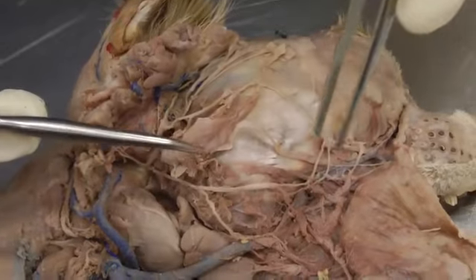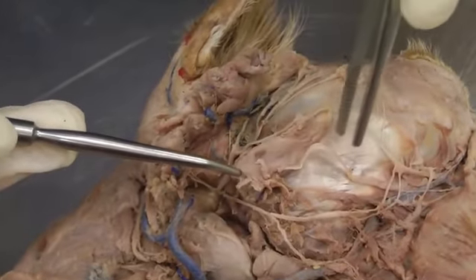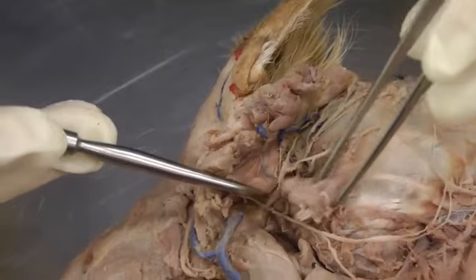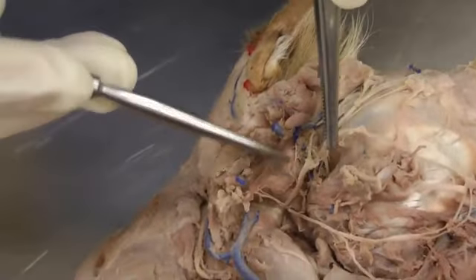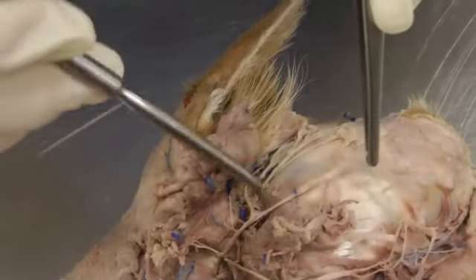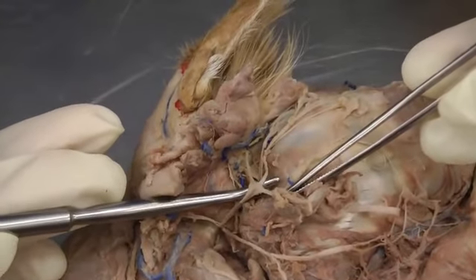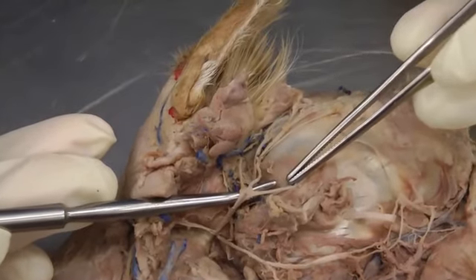So that's ventral buccal, and here we've cut apart the parotid salivary gland, but I kept the parotid salivary duct right here. So parotid duct is here, ventral buccal is here, and then we continue to follow and find the dorsal buccal nerve here. So dorsal buccal, and then our auriculopalpebral nerve is kind of coming off in two pieces here, but this would be auriculopalpebral where that comes off of the facial.